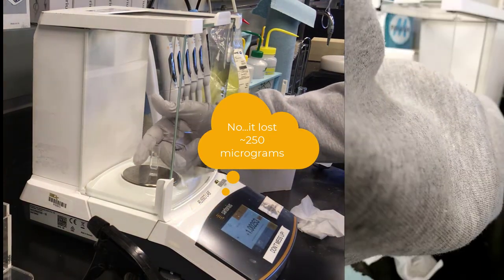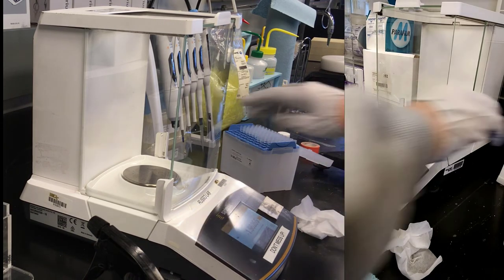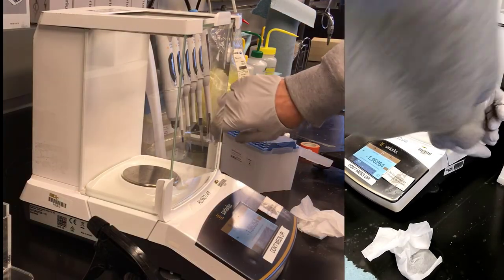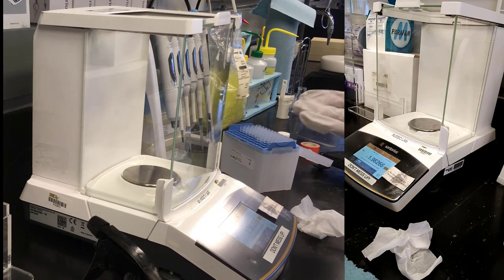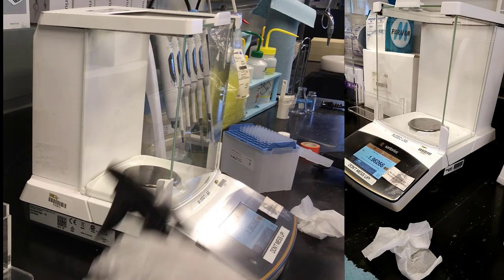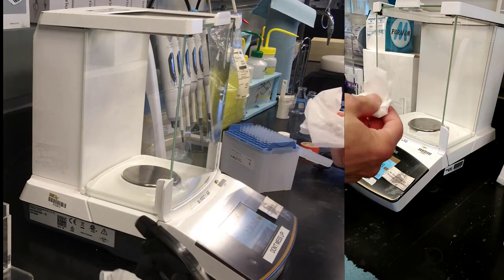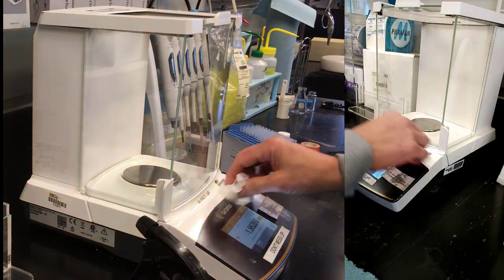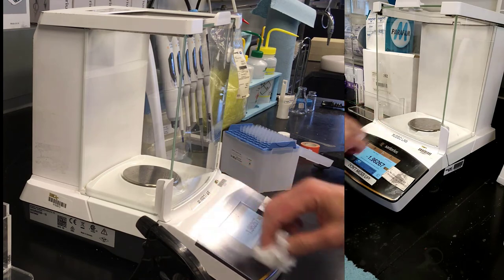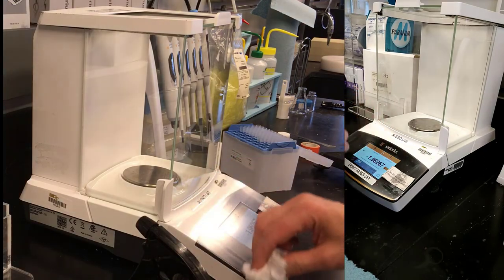Now, we're done. Again, I use my knuckles, they're usually pretty clean. And because I had actually touched it once with my hands, I'll go ahead and sanitize it quickly. And squirt a little bit of stuff. This time I think I'll put it on the wipe itself. And I can tell you that we're going to be glad to have isopropanol back again. It's nicer.